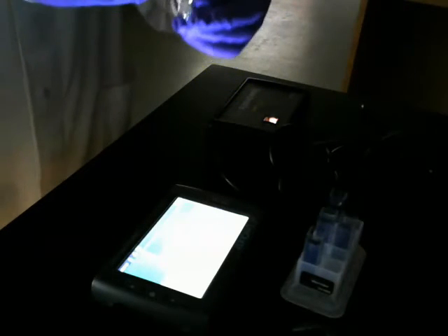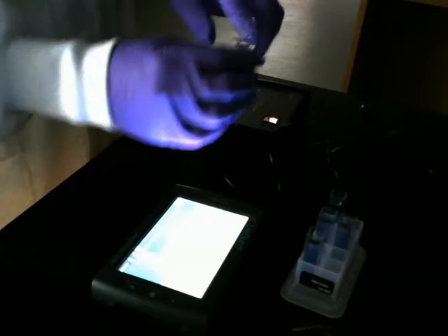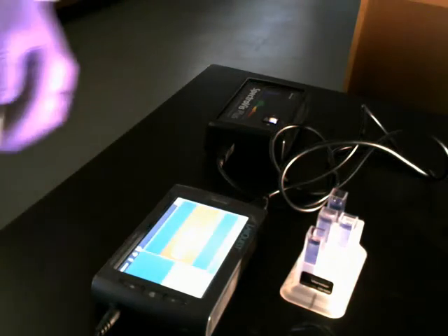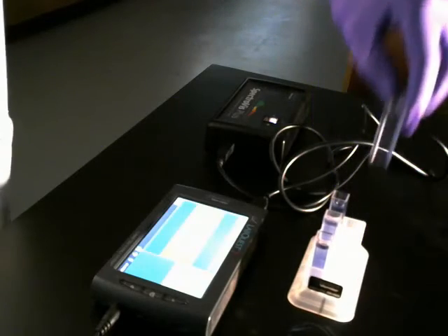I need to slip it back into its aluminum sleeve, close the little lid that I had for it. And we're underway. Now I'm going to put my no chloroplast out in place.